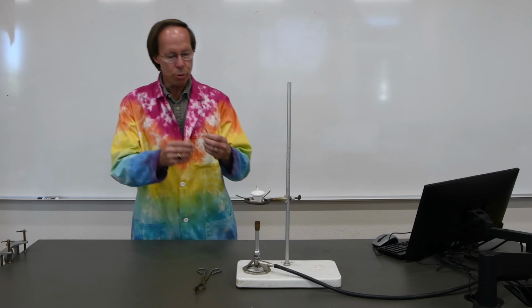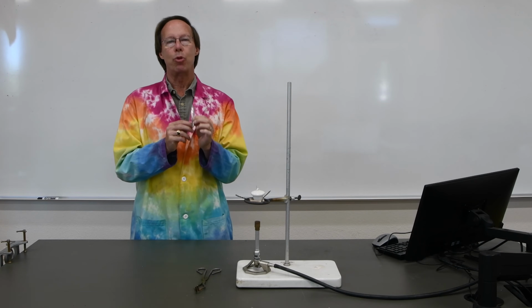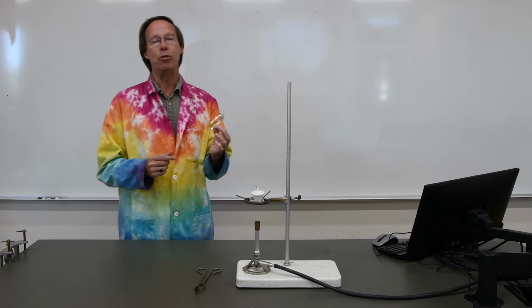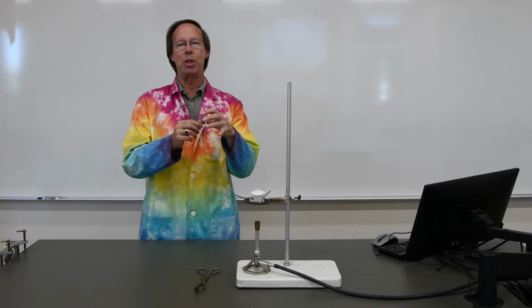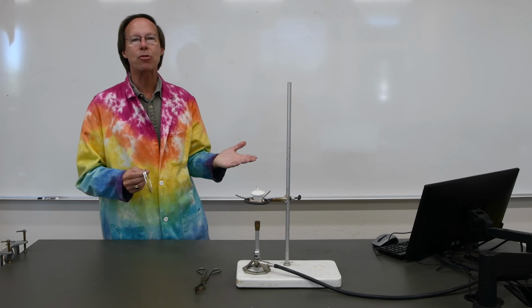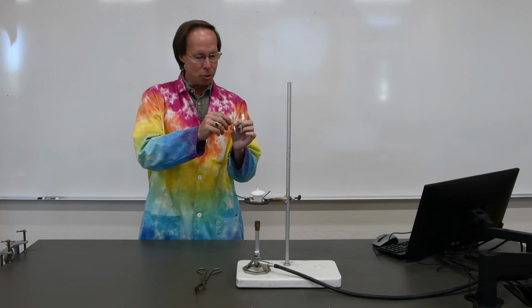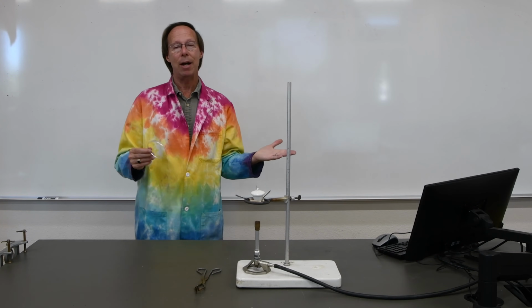We're going to start out instead with a piece of magnesium, and we'll be able to weigh that, so we have our grams of magnesium, and then we're going to burn this magnesium in air and convert it to magnesium oxide. So as it burns, of course, oxygen is going to be combining with the magnesium, and the mass is going to increase, and that increase in the mass will be our grams of oxygen. So at the end of the experiment, when we weigh the grams of magnesium oxide, we can simply subtract our initial mass of magnesium, and that will give us our grams of oxygen.